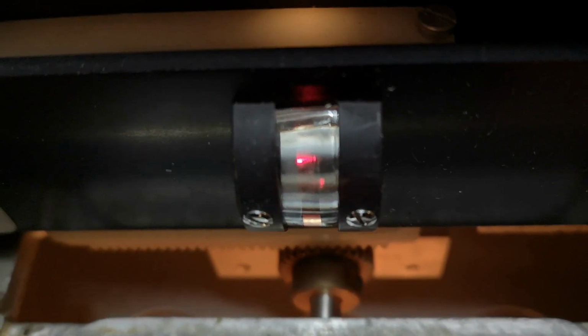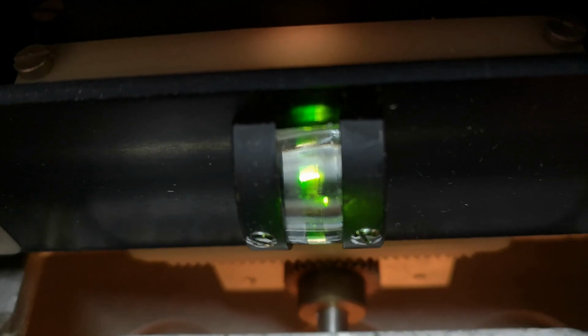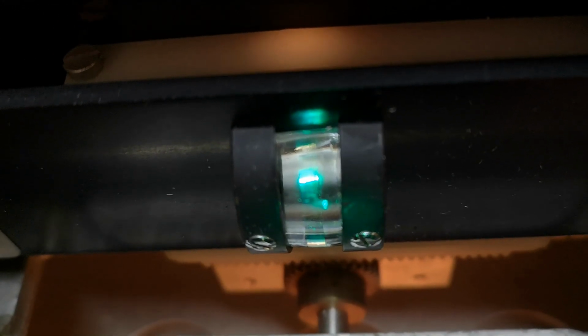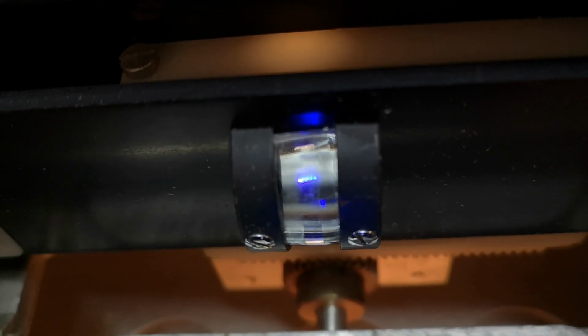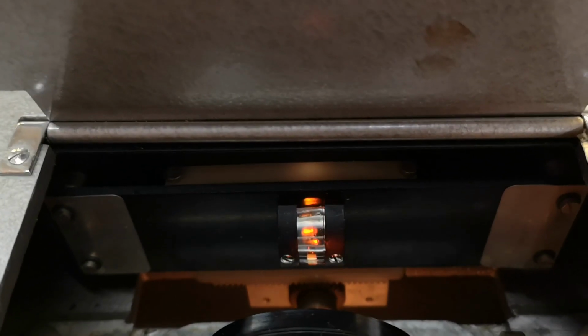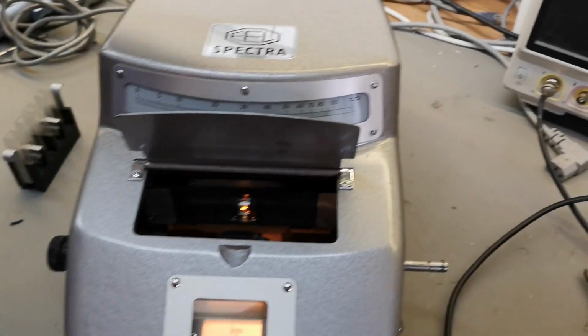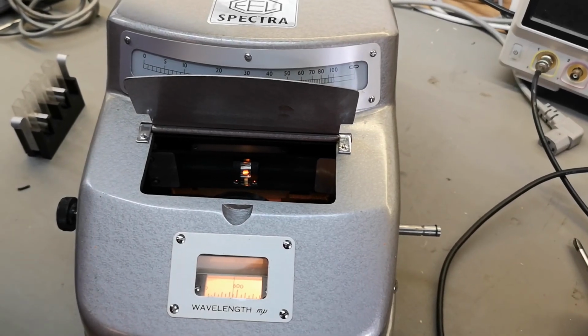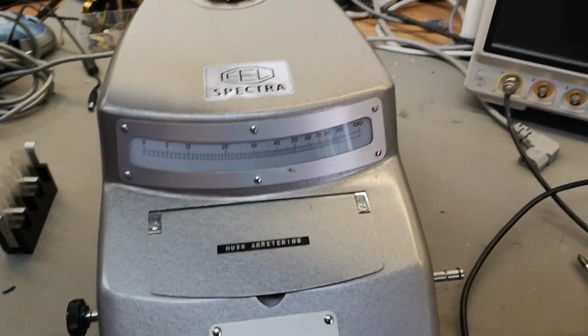Ooh. So that was 700. Oh, let's try that. 650. 600. 550. 500. 400. Oh yeah, this is 475. 450. 425. And then all the way to 400. I really love it. Aha, so that is how this thing works. I think there's a bulb missing because we don't see anything up here. Yeah. But anyway, this is what I will do.